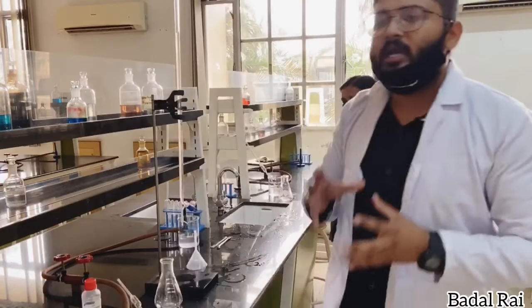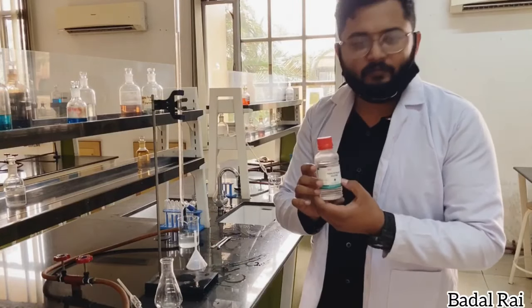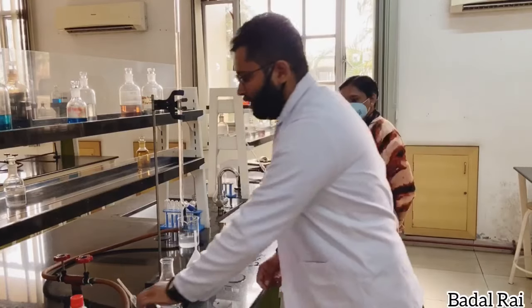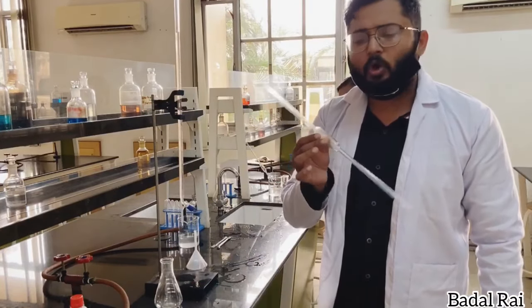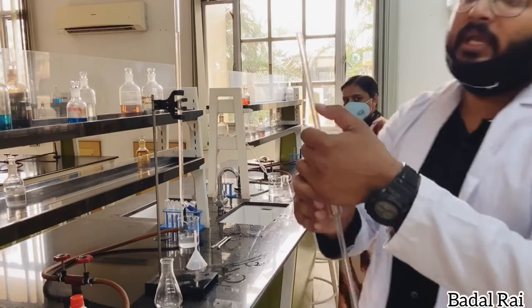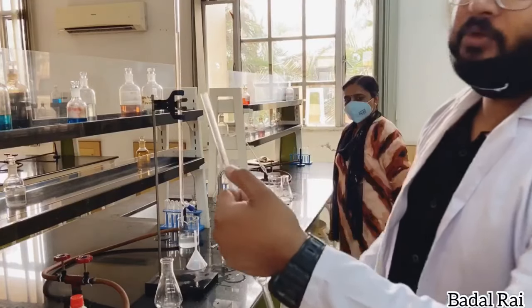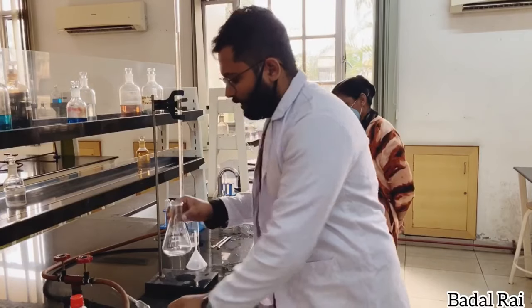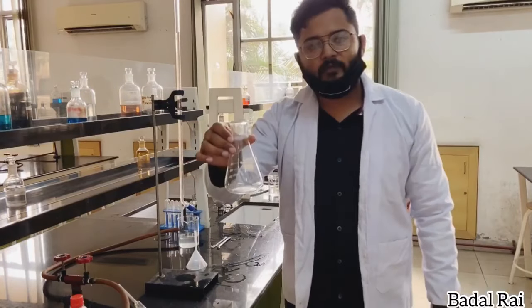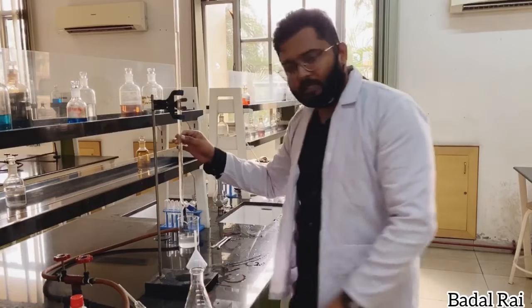For this titration and reaction, we need an indicator — we will use phenolphthalein. We also need the apparatus: this is the pipette, we call it a pipette. We have 20 ml here, we suck it to take the 20 ml measurement. And this is the conical flask which the pipetted solution will go into.